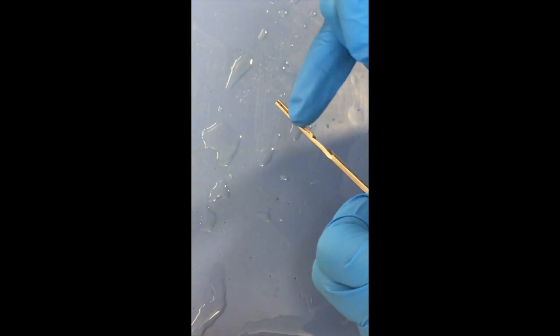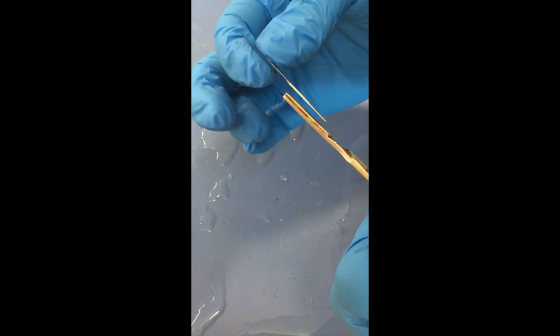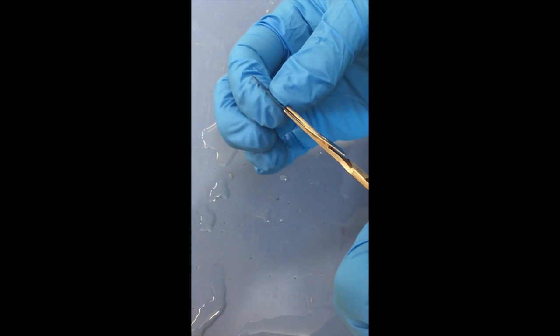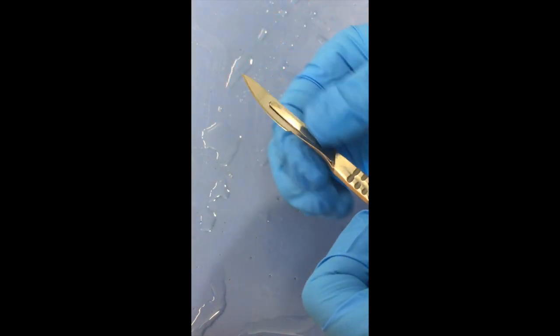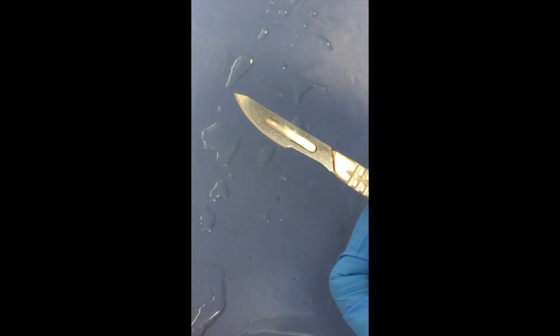Do you see how there's a little groove right in there? And so you want the blade to be able to slide into that groove and then you snap it in. That's it.